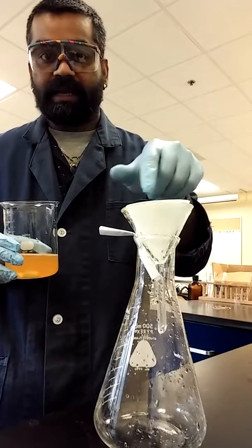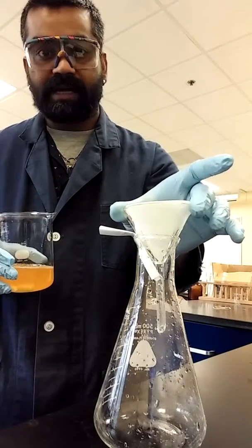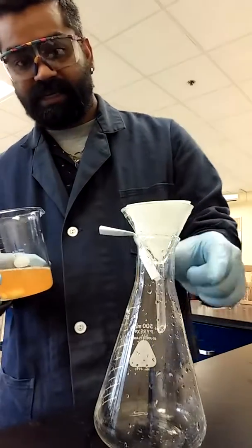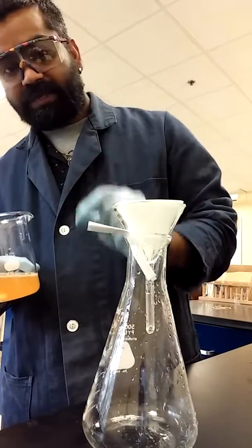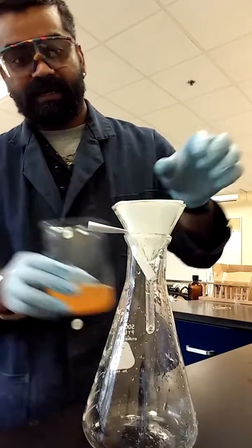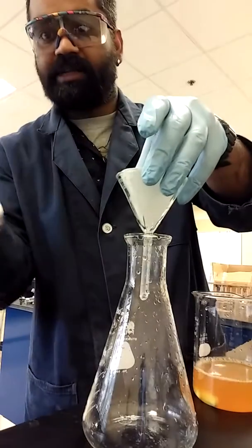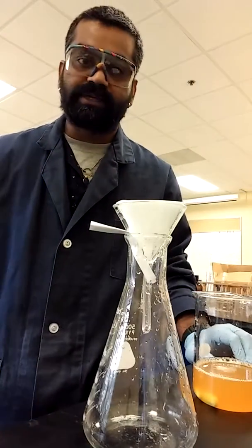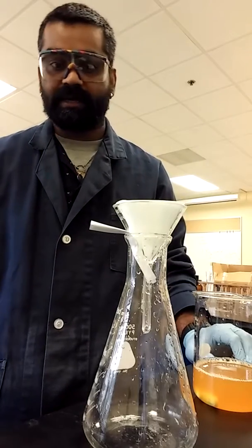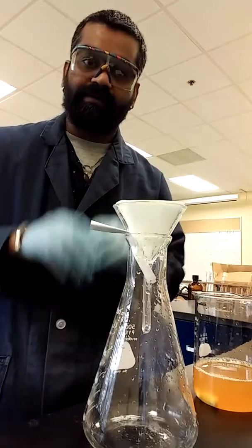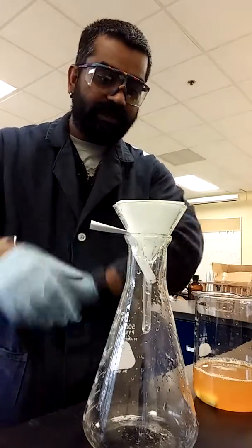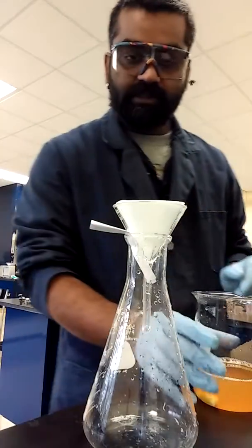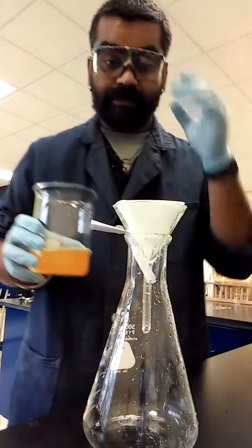I got a funnel and I got a Whatman filter paper inside of it and you see this little technique. I just took some paper, folded it and made it into an L shape and just stick it in. Now this is something I learned from my high school teacher way back and you can figure out why we do it, but I'm going to do it. You can figure out the reason is what I meant and it's pretty simple.